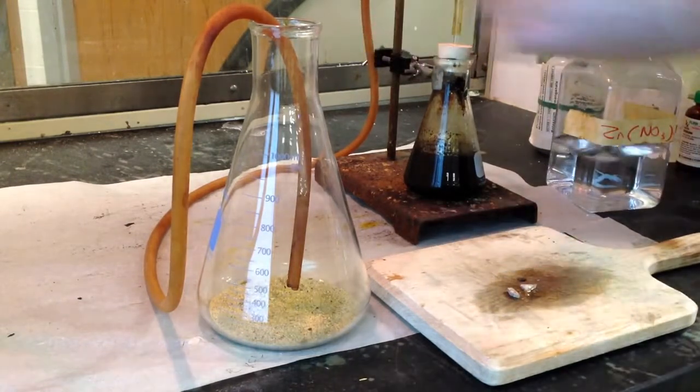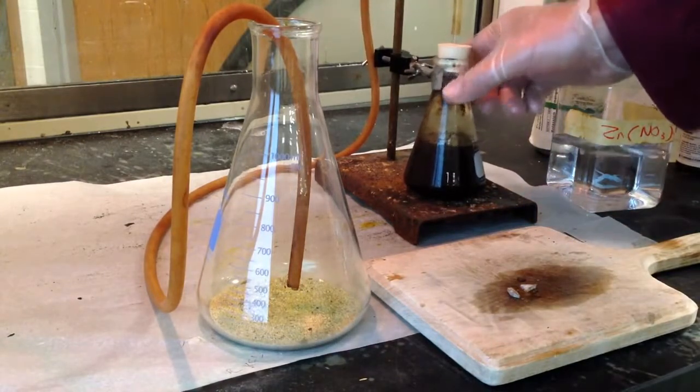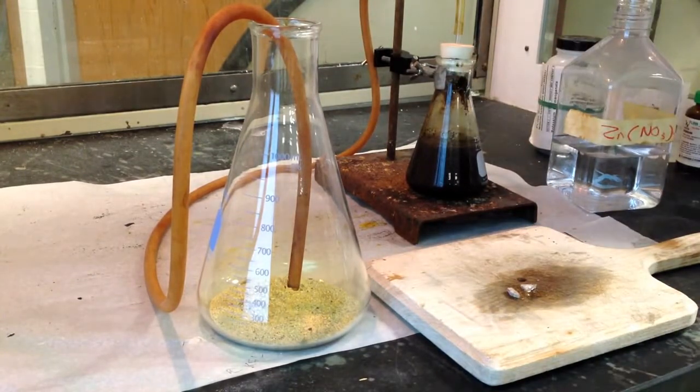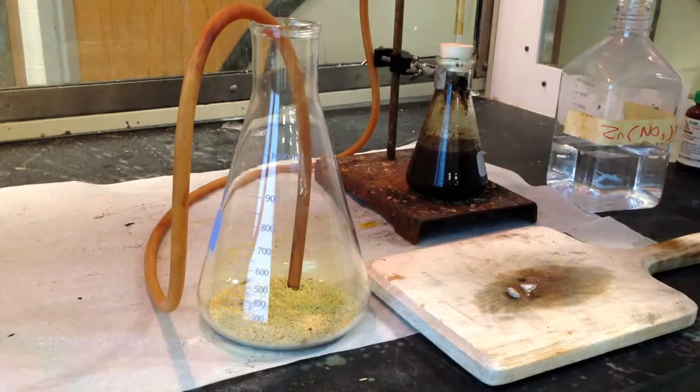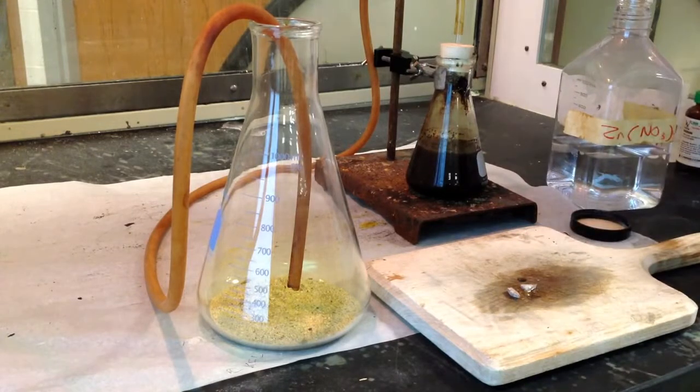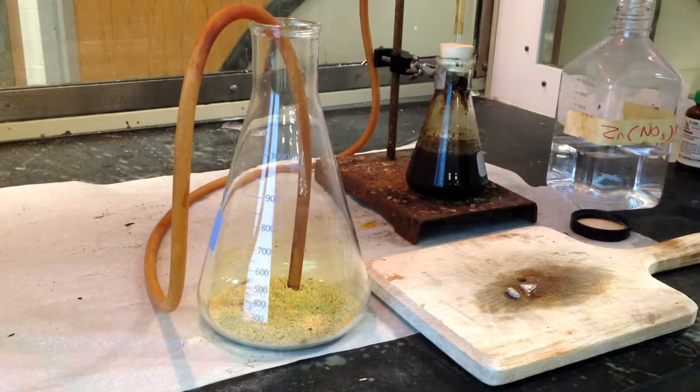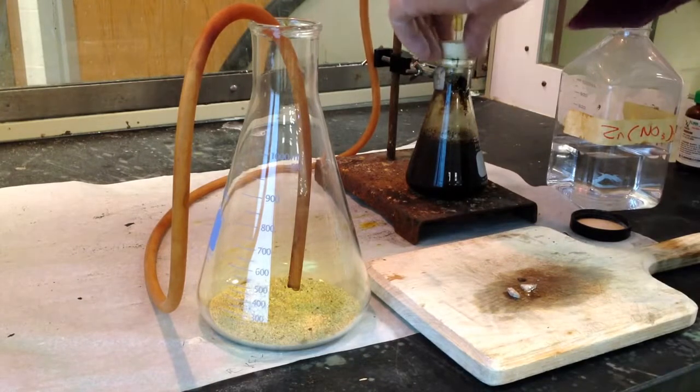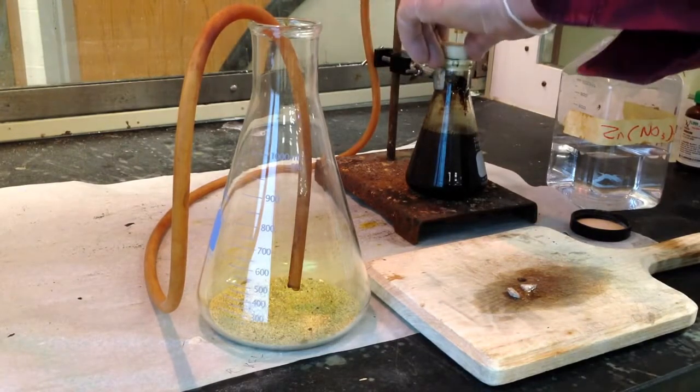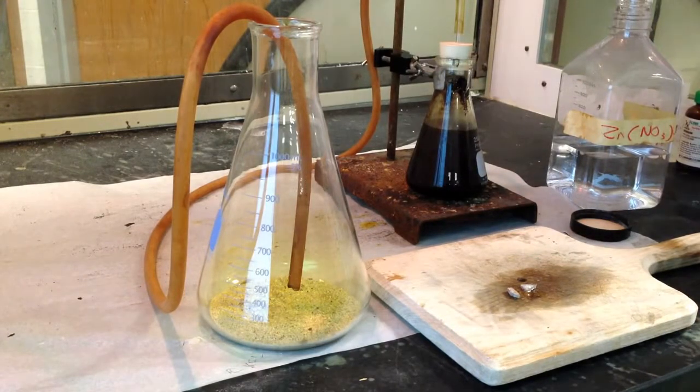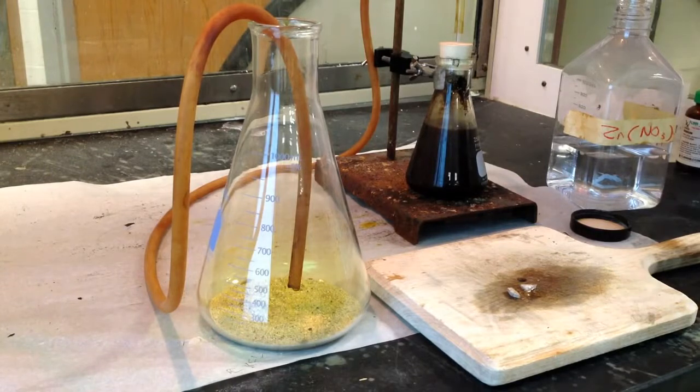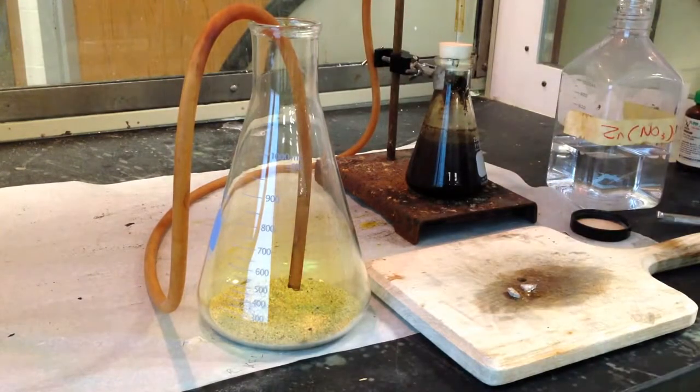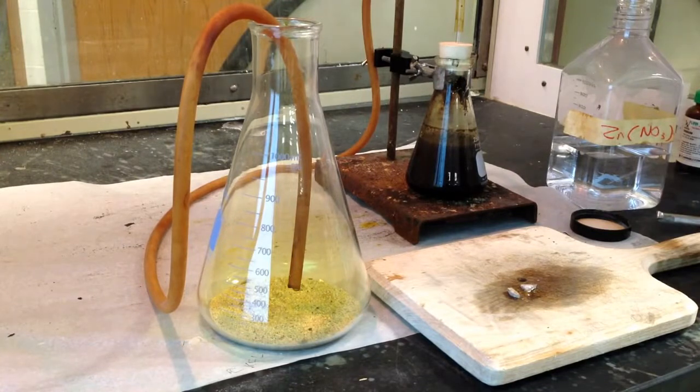I may need some more potassium permanganate. But the flask should get yellowy green. And let me just add, just to make sure, because I want to make sure I'm filling that flask up. I see it getting yellowy green, but I'm just going to add a little bit more potassium permanganate into the mixture, the chloride ion mixture. And you can see that green color, that yellowish green color.